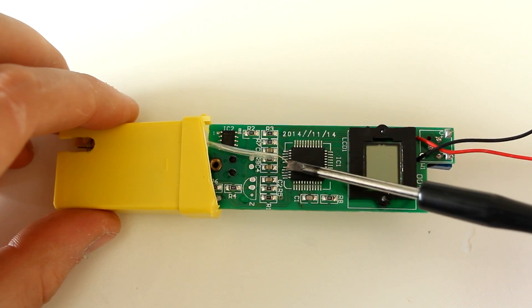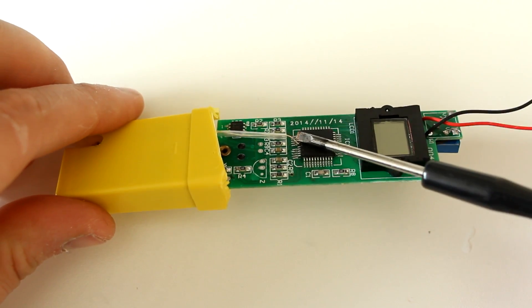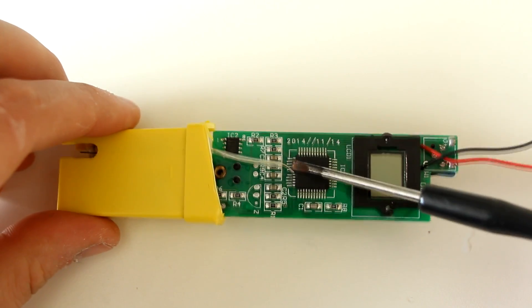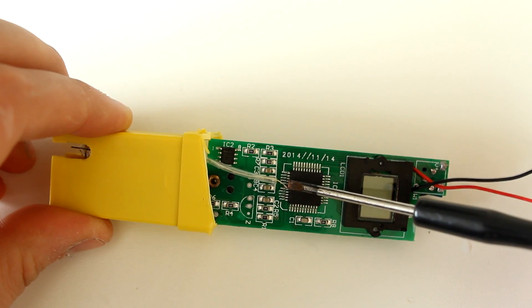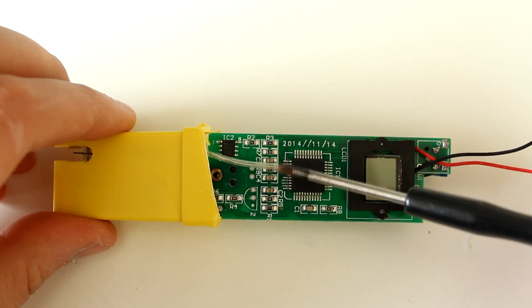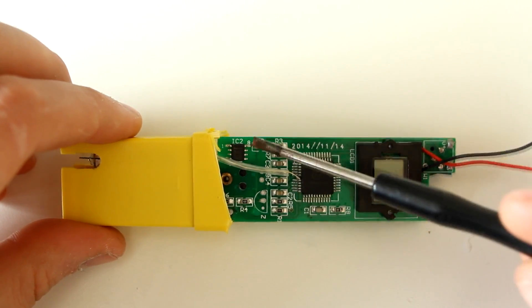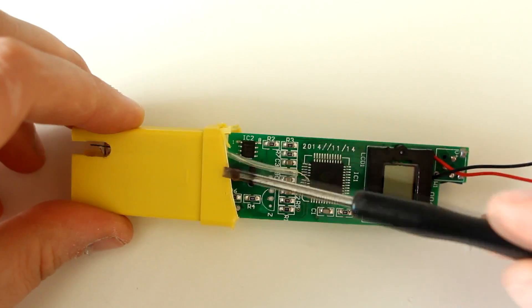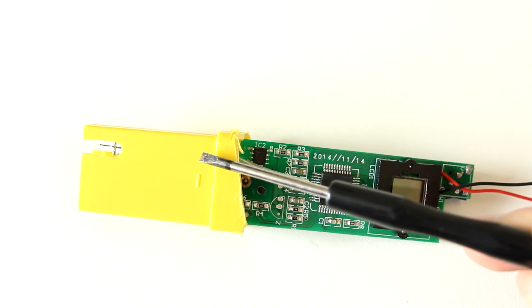Clearly the actual tester just goes directly to a pin on the microcontroller. This pin has been lifted and manually soldered pretty badly, but it kind of fits - it's been heat shrunk so it's kind of okay. Apparently all the magic is actually in the pH meter bulb or whatever it is.